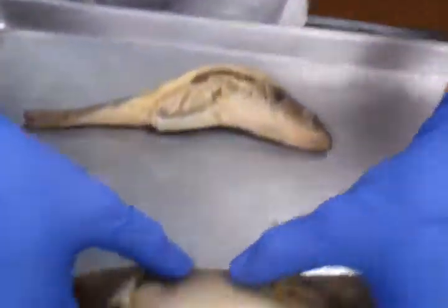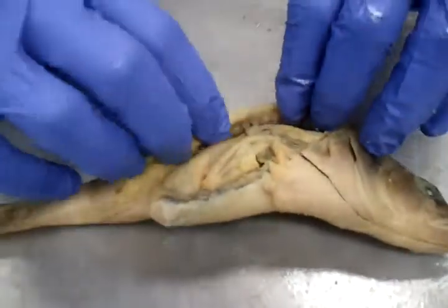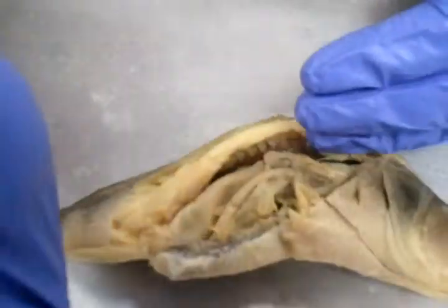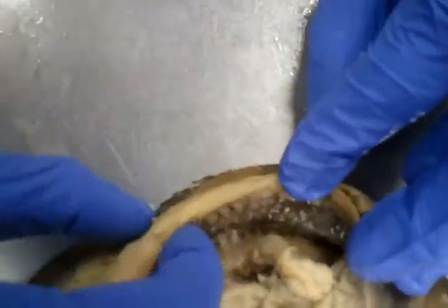Now we're going to put this fish aside for a moment because its anatomy is very particular. We'll come back. So first of all, remove this outer layer here, and let's just dig right in. Let's start dorsally and then move ventrally. Very noteworthy, we have the spinal cord. And look at this, you can actually see the individual vertebrae.